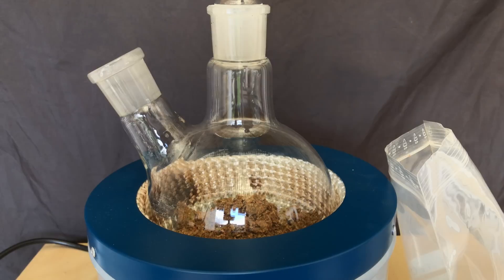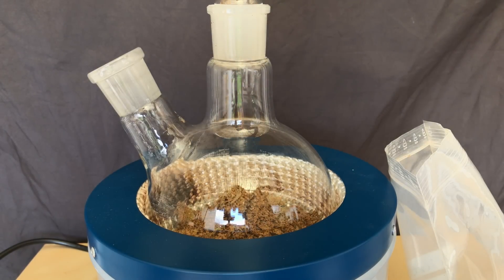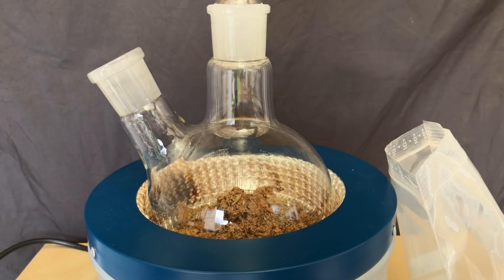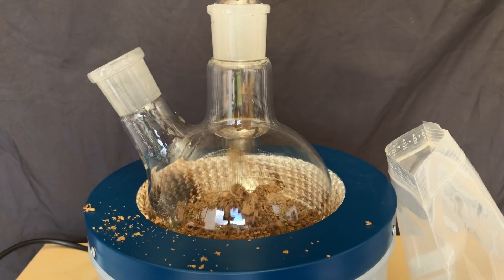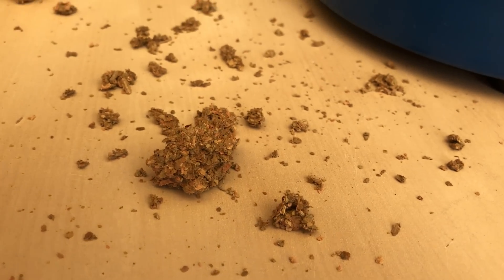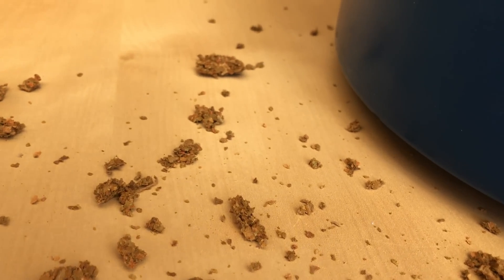Using a glass stir rod, we forced all of the tobacco into the round bottom flask. While transferring the tobacco, I had a little accident and spilled some of it. If you ever want to have a closer look at homegrown Nicotiana rustica, here's your chance.